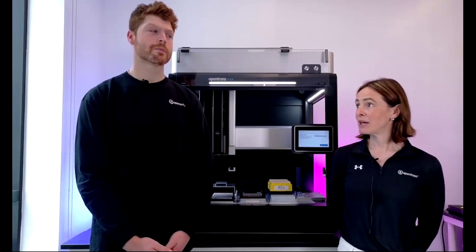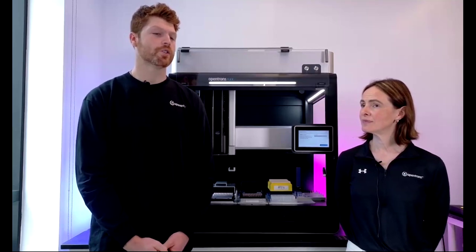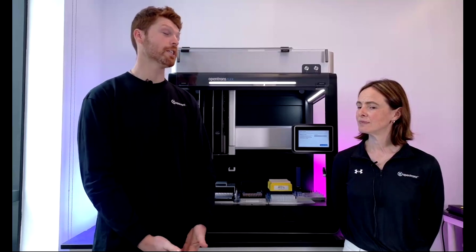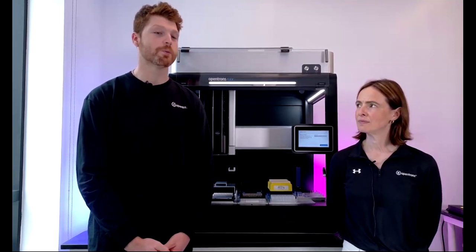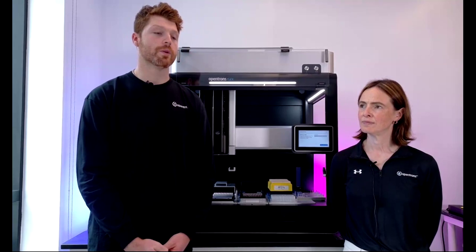Let's see what we have here. How long would it take the P1000 pipette to aliquot 9 microliters to each well of a 96 well plate? I don't know off the top of my head. We can definitely work it out. In terms of being able to multi-dispense off of that, it should be relatively quick. I would say the fastest solution there would be a 96 head, as well as once we unveil the ability to do partial tip pickups with that 96 head. I think that is probably a good way to move forward on that.